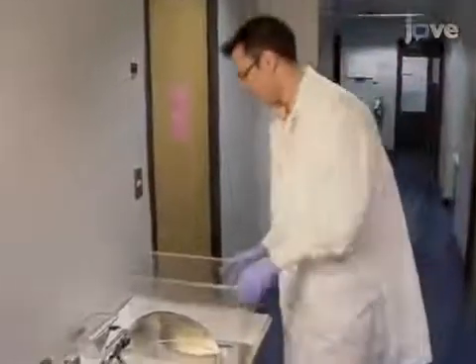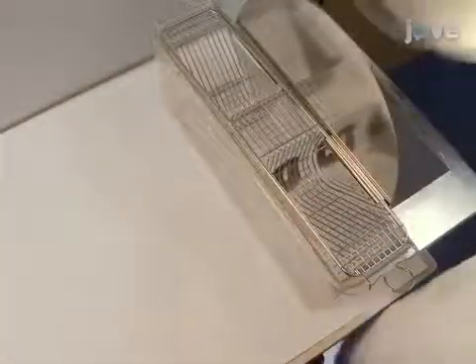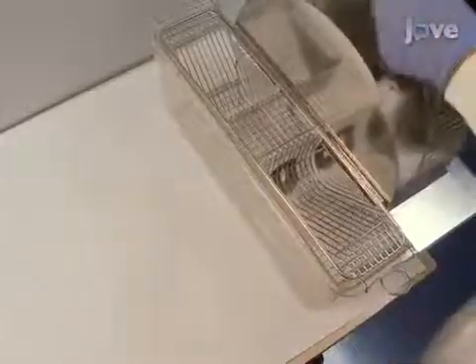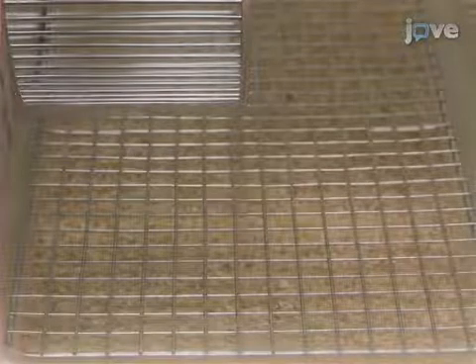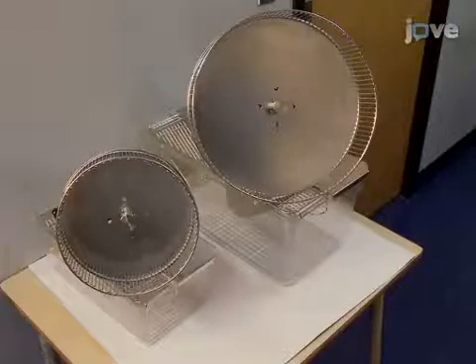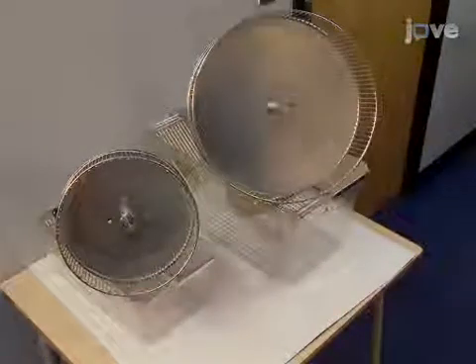Begin by setting up the home cage. Each rodent should be singly housed with enough room for a running wheel. Cages with mesh flooring are used to eliminate any possible neophobic effects of frequent bedding changes. Smaller, lighter wheels are used for mice, while larger, heavier wheels are used for rats.